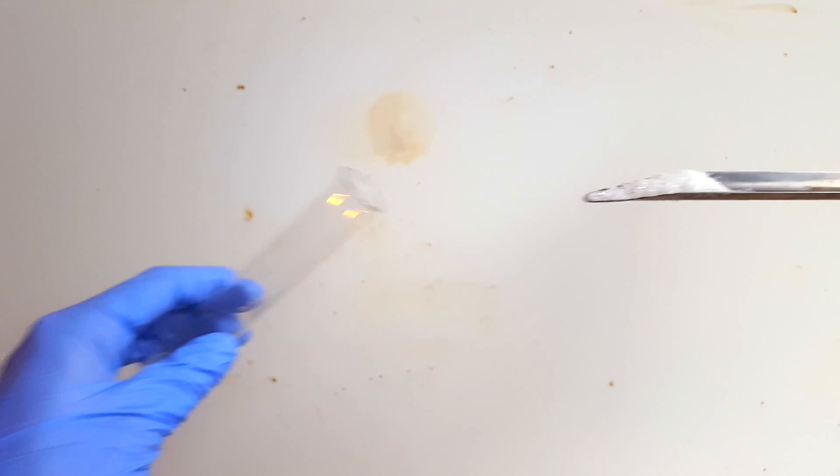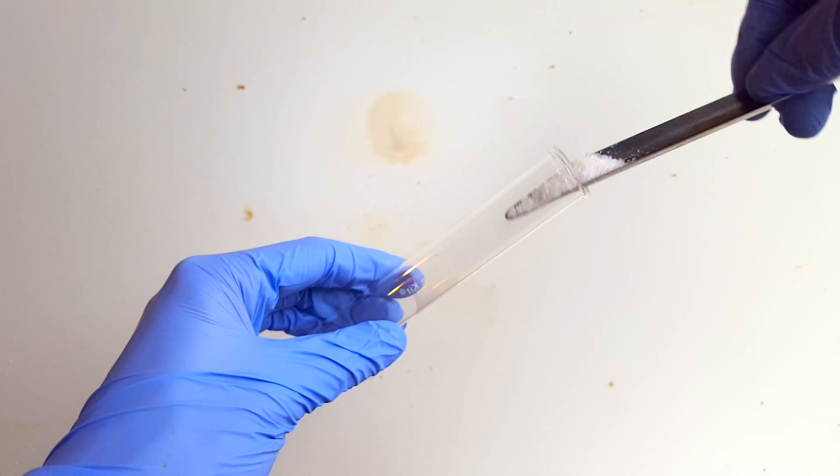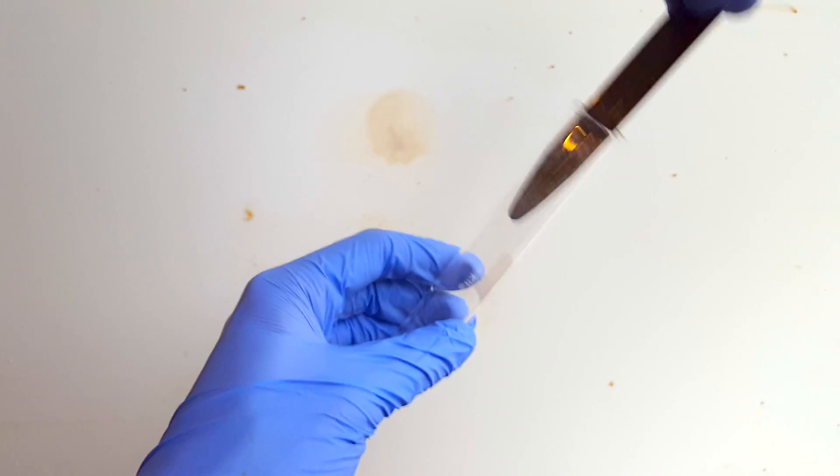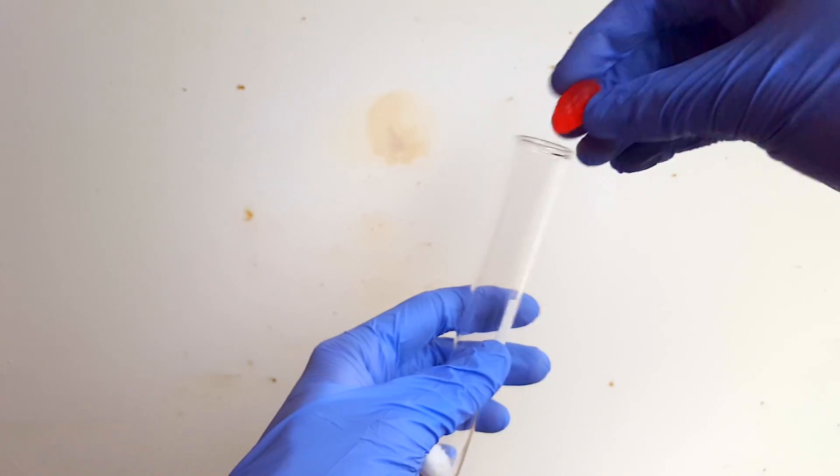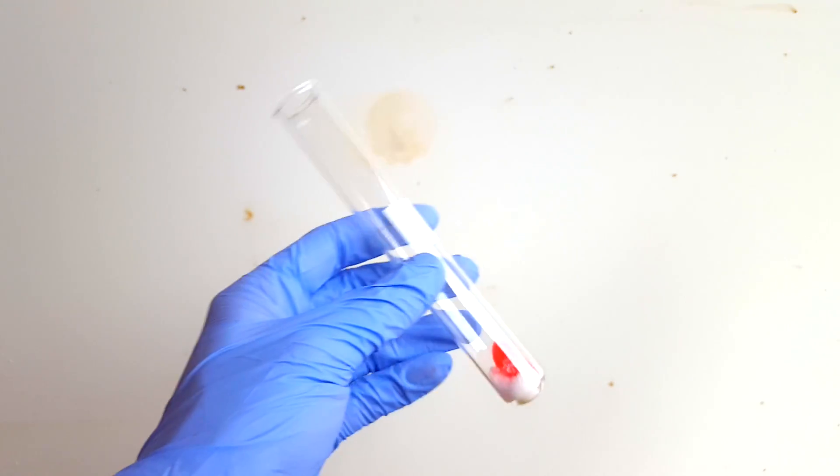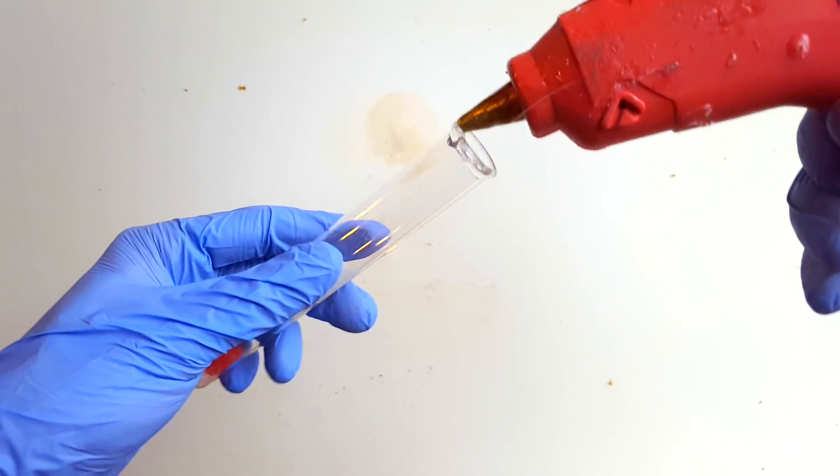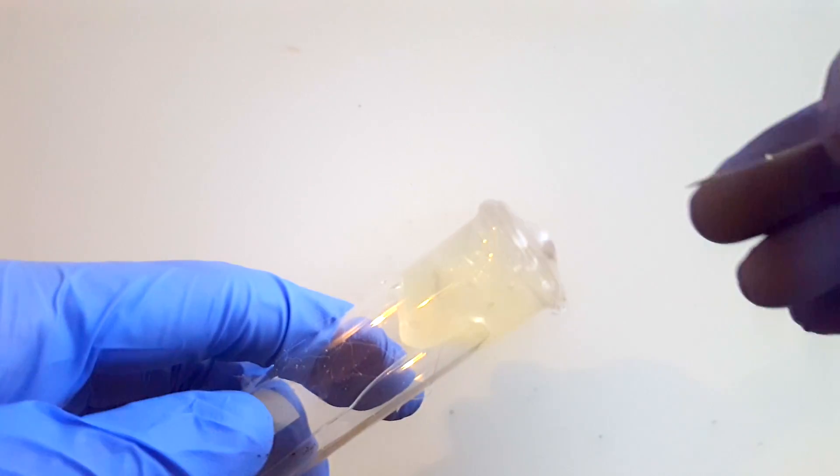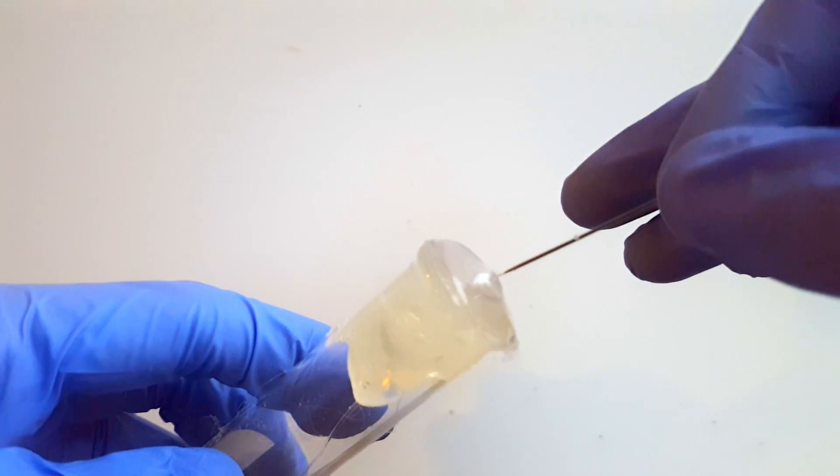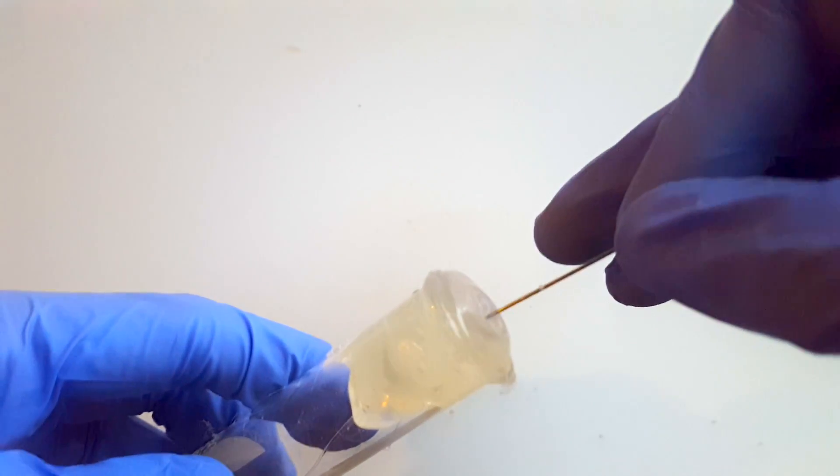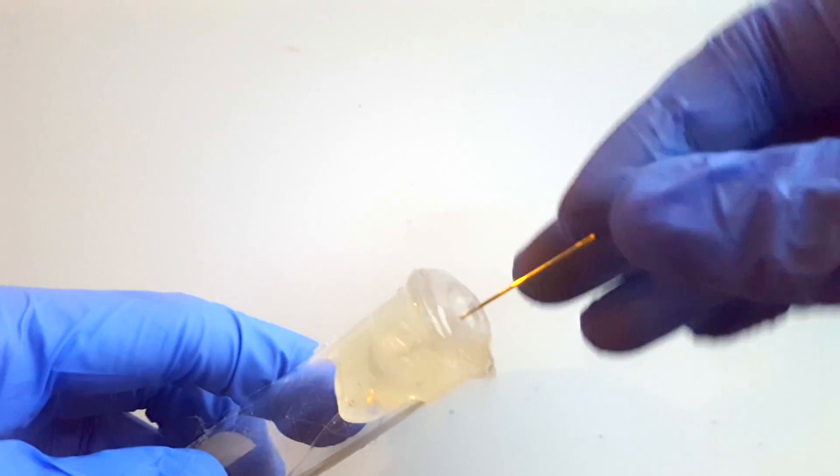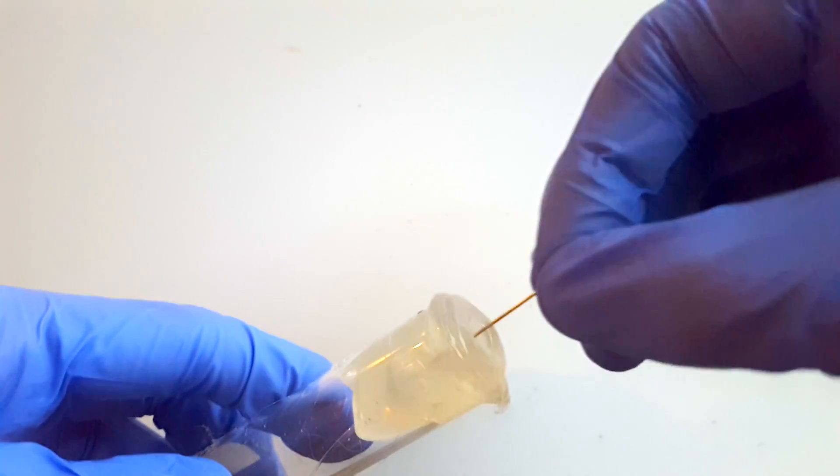To make it, I simply took a test tube, added some sodium chlorate to the bottom, added a gummy on top of it, and then sealed the top using some hot glue. After struggling for a while to get a good seal, I poked a hole with a needle through the hot glue to make a place for the hot gases to escape, producing the thrust to get the test tube moving.